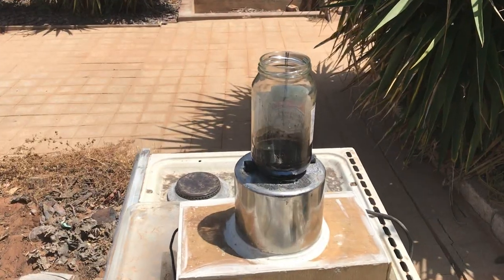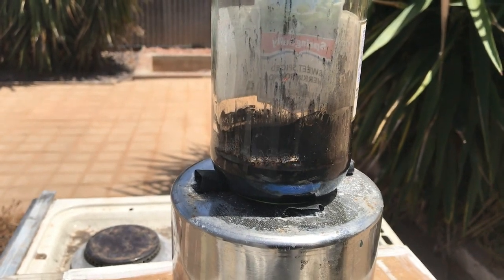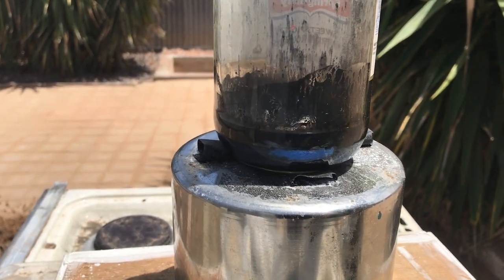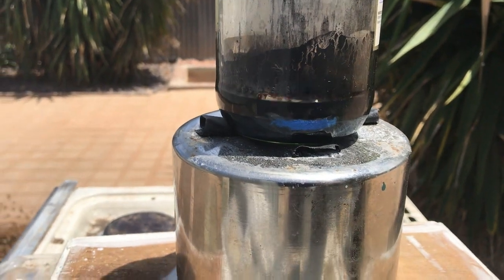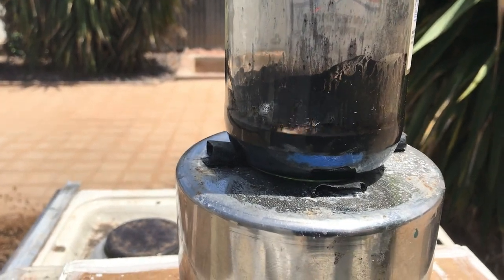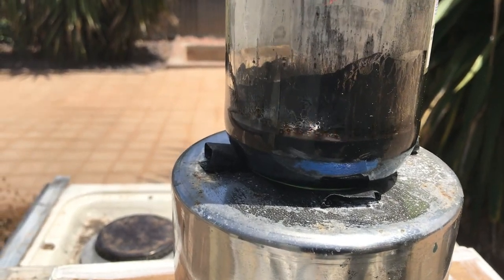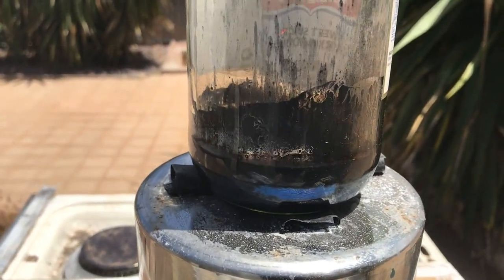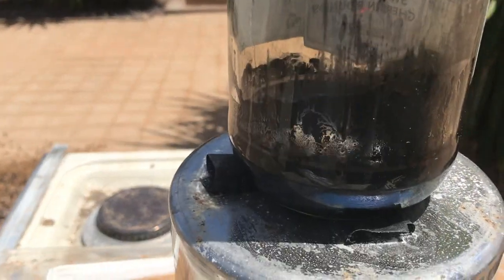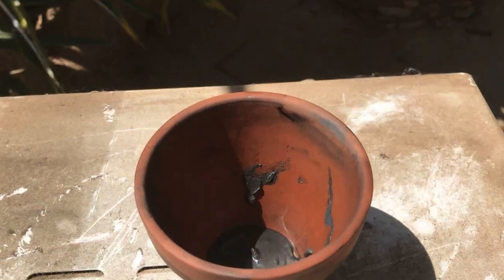In the vessel we have 20 ml of around 96% sulfuric acid with 5 grams of 50 micron 95% pure graphite, and 0.5 grams of potassium permanganate added slowly — it never heated up or anything. I'm going to stir that for an hour. I had to start off with 35% sulfuric acid and reduce it in the oven three times.